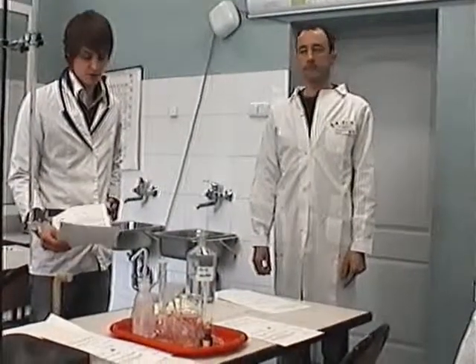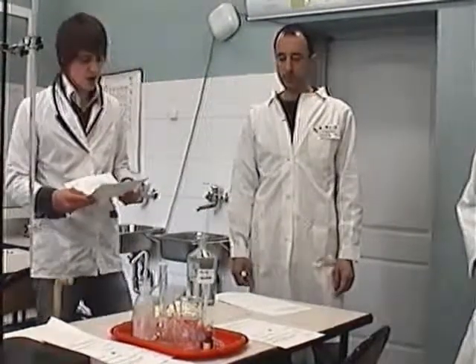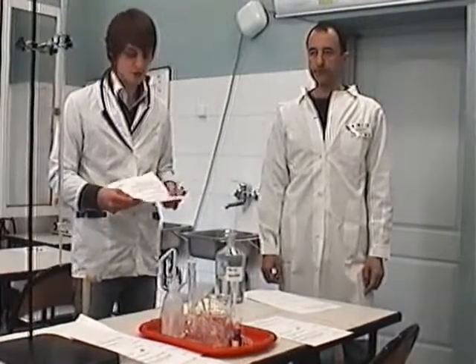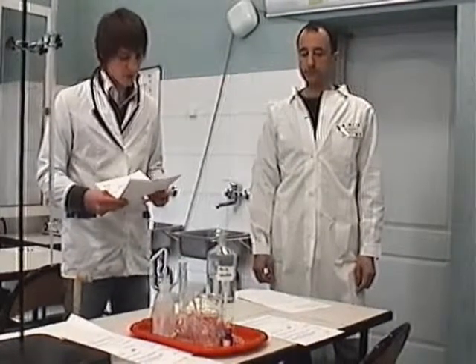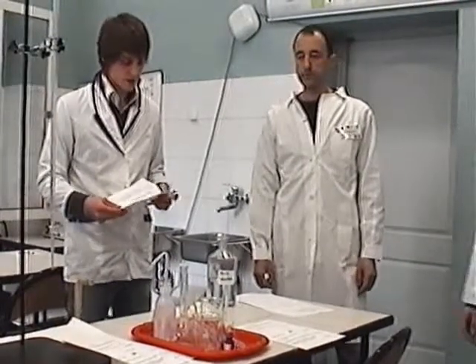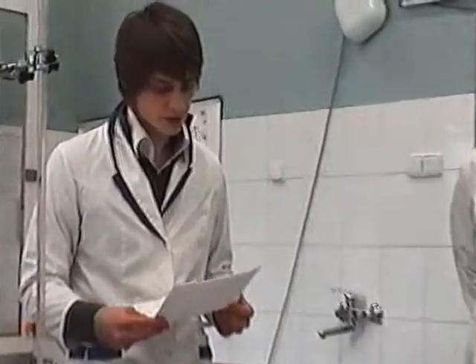Hello, Victor. In some countries where fresh water is scarce, desalinated sea water is the main source of drinking water. We will study today how fresh water can be extracted from impure water, typically salt water. Then we will titrate some water after distillation in order to check if the water is drinkable.